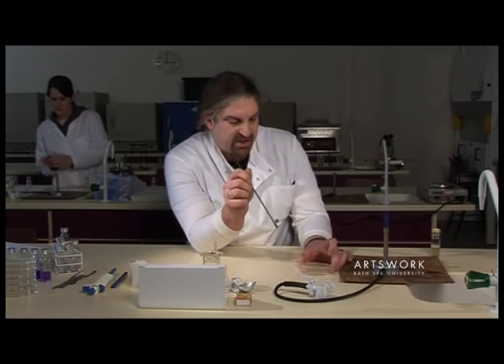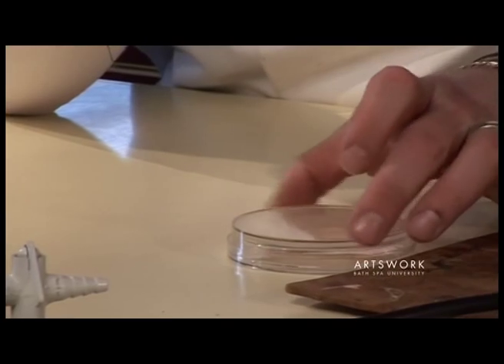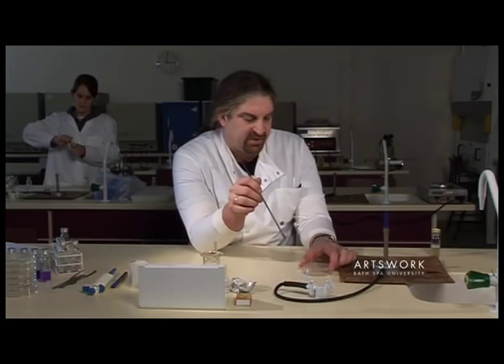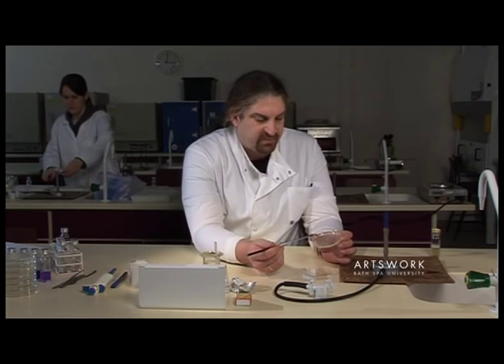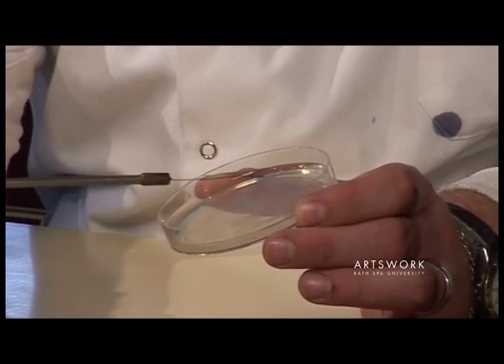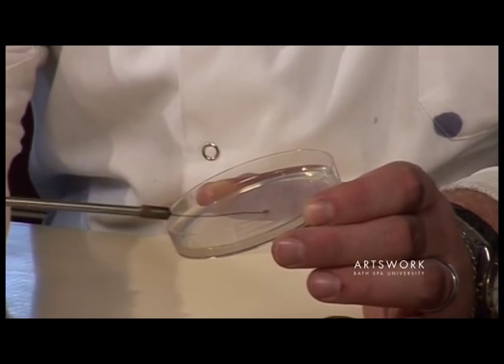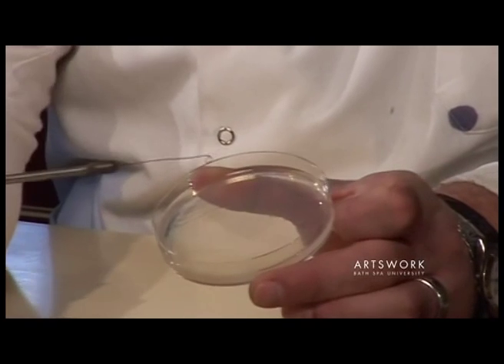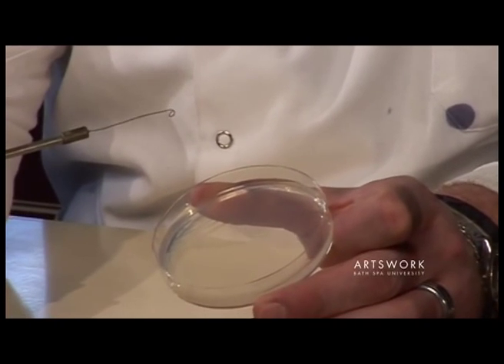For the final streak, turn the plate so you're at the end of your previous streaks. This time, draw the streaks out into the middle of the plate and up to the top, making sure you don't go back into your original culture.